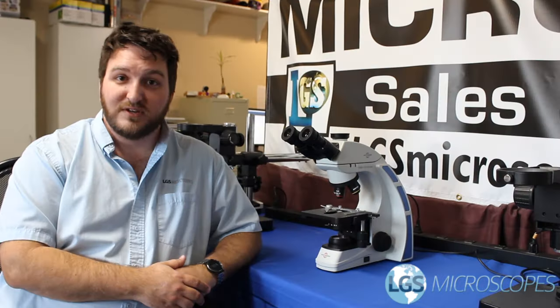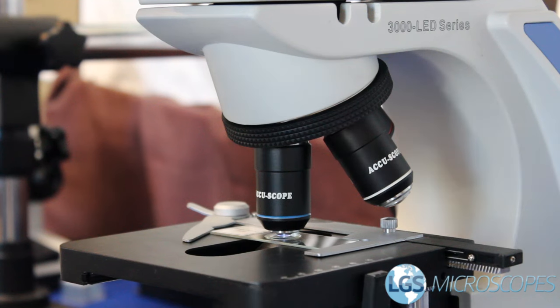Here at LGS we don't just do sales and training, we also do a lot of service and the number one reason why we get calls for someone's microscope not working properly is because there's oil on the 40x objective.